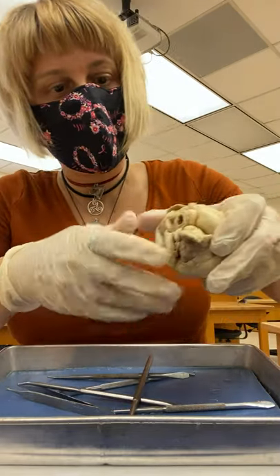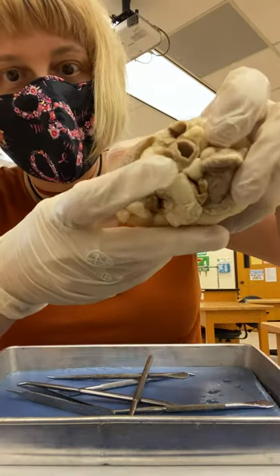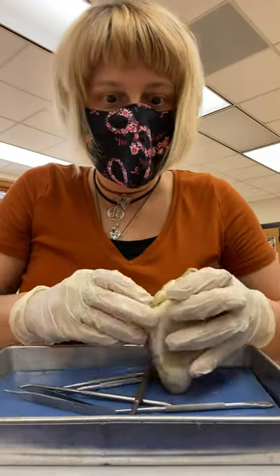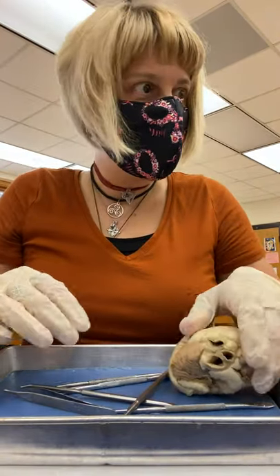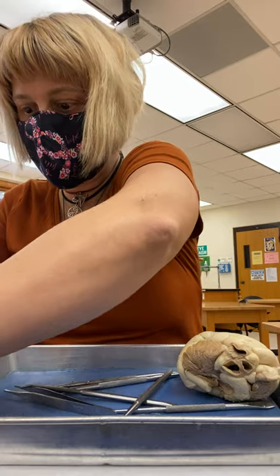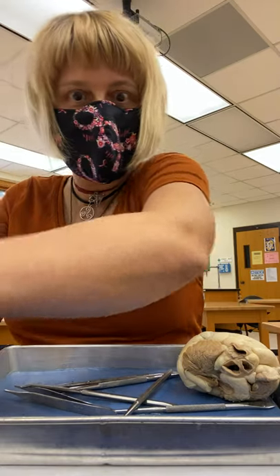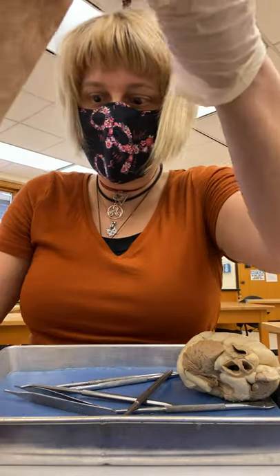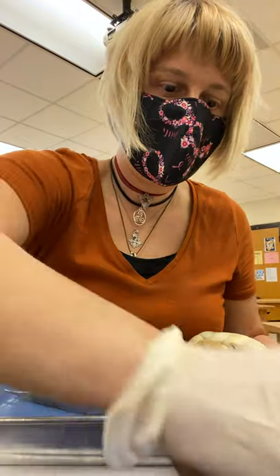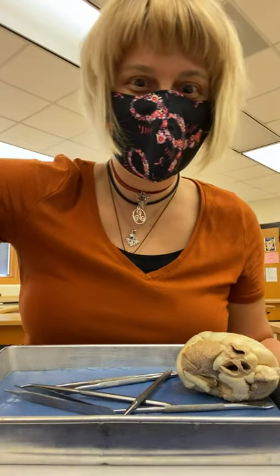It's rather large, so it's dead center. And I just got some heart juice, believe it or not, on my laptop. Hold on one second — don't worry, I will clean it up later.